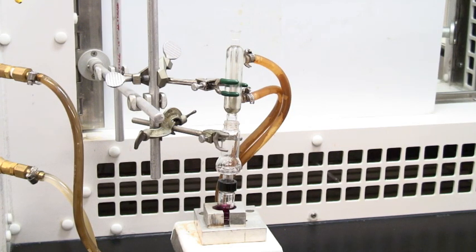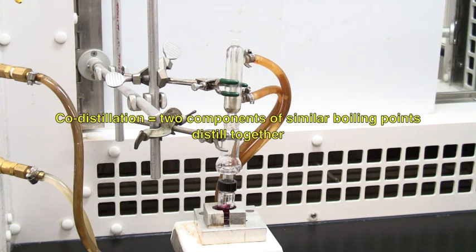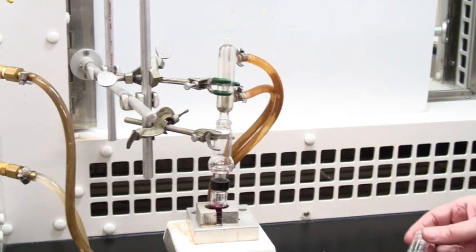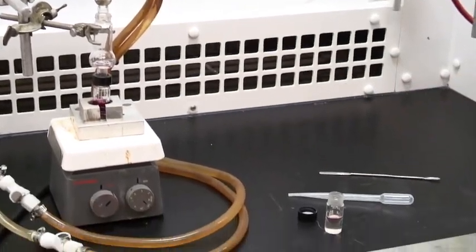You normally keep distilling until you've got all of the distillate out. Usually, you're left with not very much behind. Sometimes, when you are distilling, you will get some co-distillation. If you've got two products that boil at a similar temperature, you'll get two things out. But this is considerably better than the mixture of goo, gum, and several things I've got in the still pot. And so, starting with your distillate, you may want to refine that.